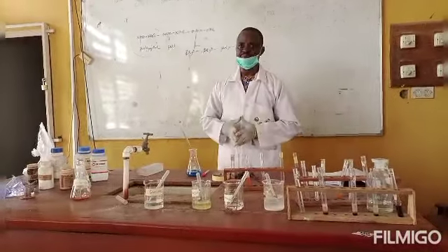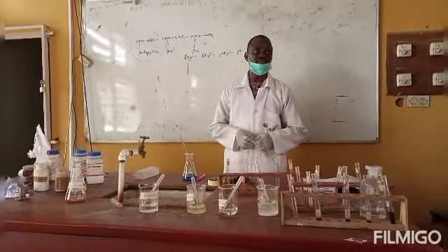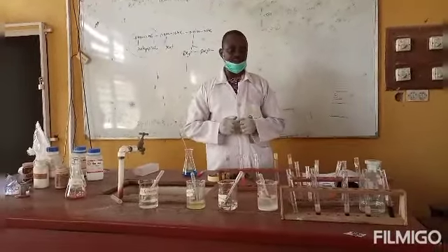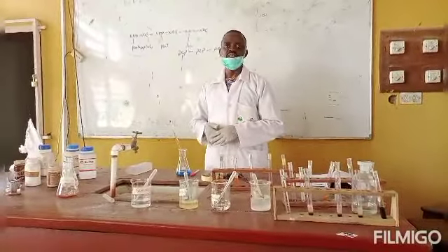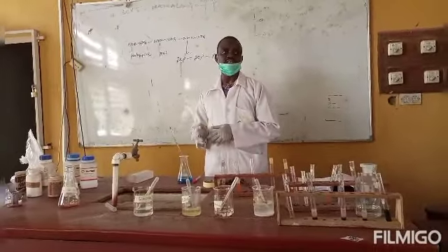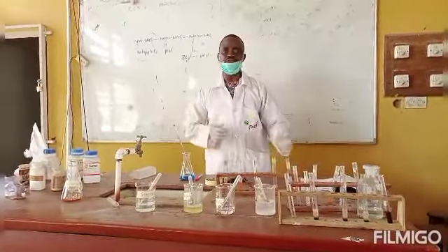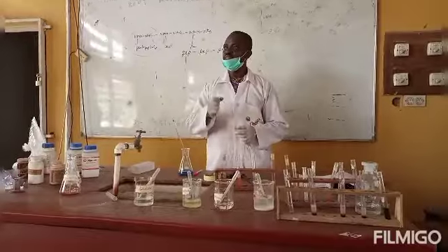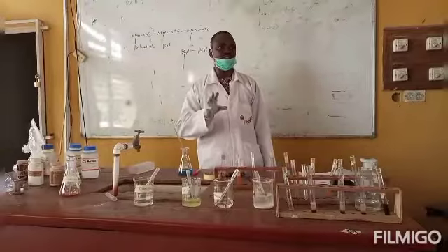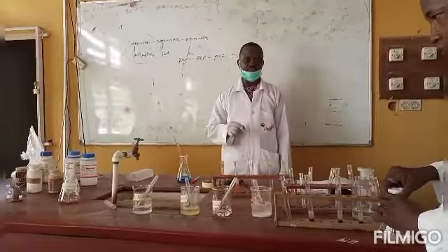If it does happen, by applying Benedict's reagent and heating for 2 to 3 minutes, there's a possibility that hydrolysis of the glycosidic linkage has taken place, whereby you will now see the glucose monomer in it reacting positively. The reaction may not be as prominent as that of a reducing sugar, but you will see a change of color from bluish to maybe dirty brown or greenish, to tell us there is a mixture of color in it. That's the next thing we'll quickly carry out now.